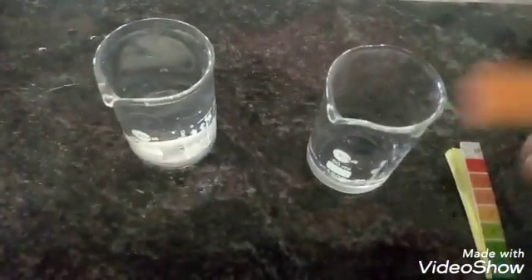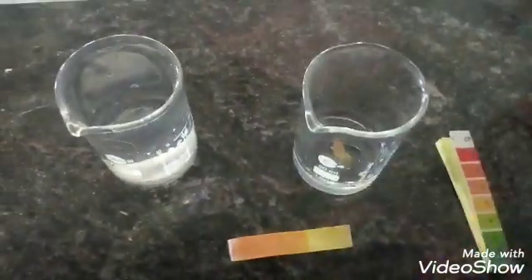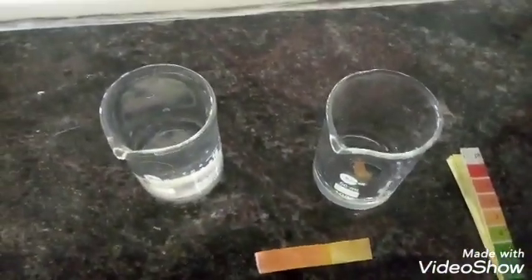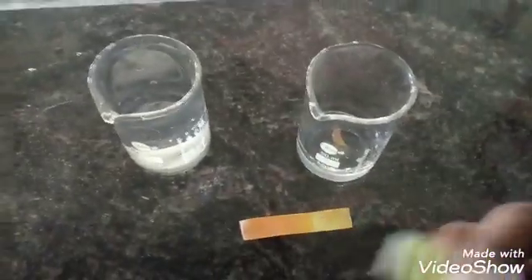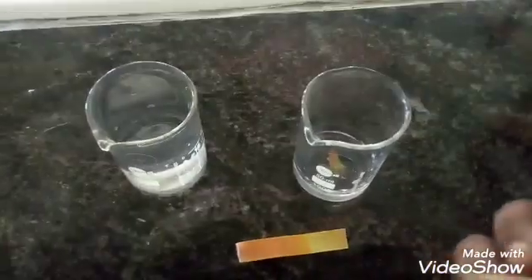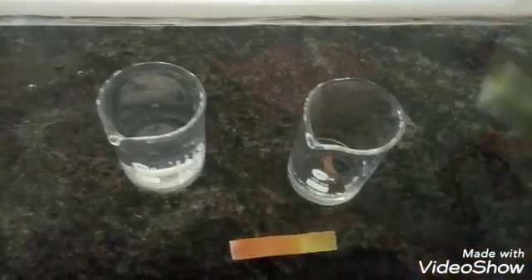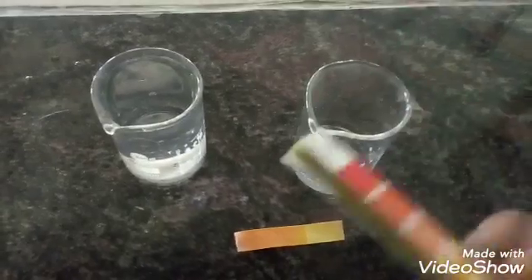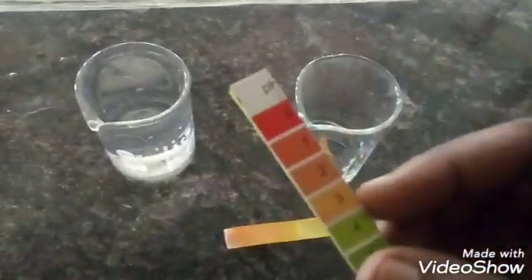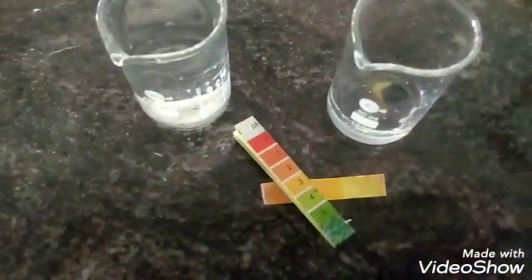In case, I will go and test it. I will tell you how to test it. What pH is going on in the water? It is a matter of the pH for drinking purposes. We will see how to test it — this is a simple experiment. We can use it in our master class. Let's try it. It's time to test it. Thank you.